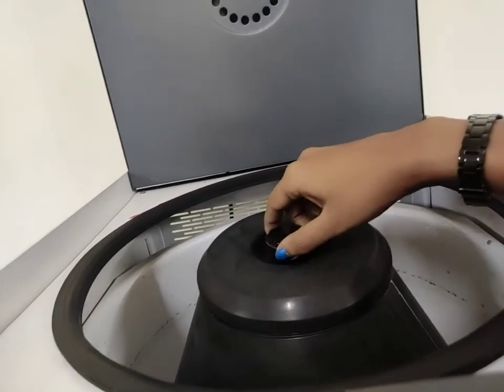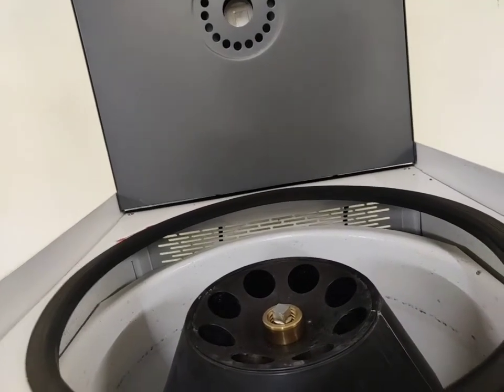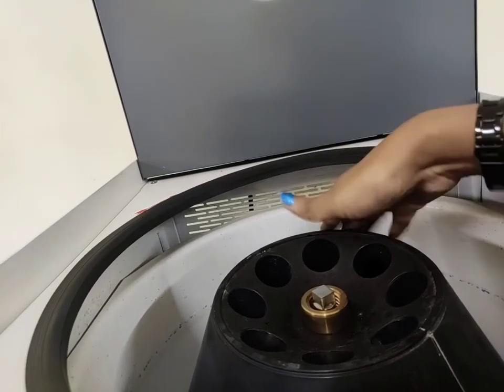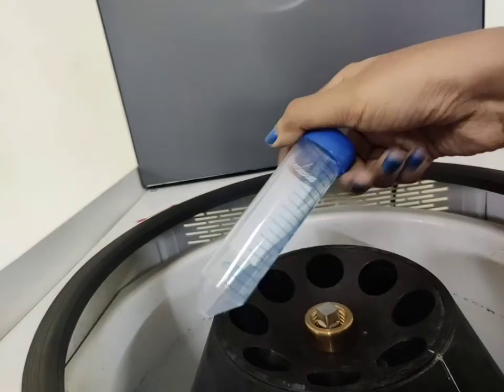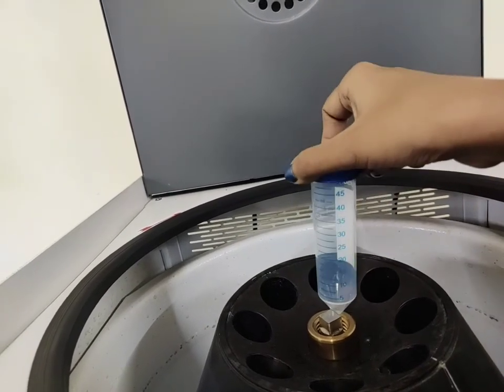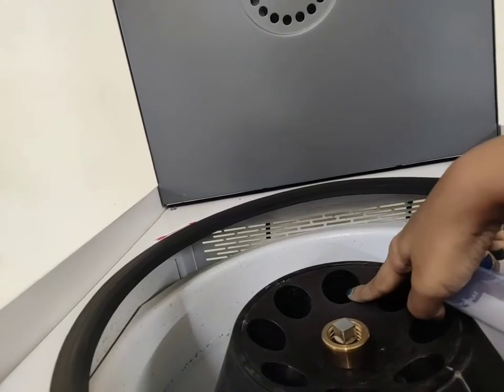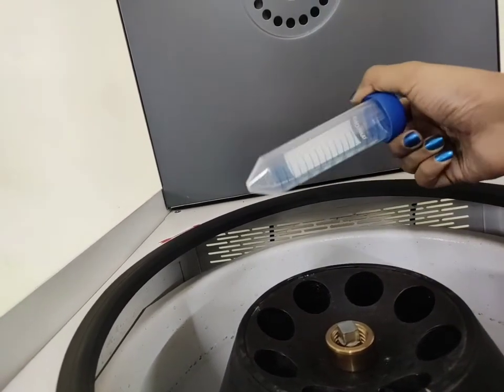For keeping the sample, you have to open the lid of this rotor — this is for safety so that your sample does not fly out during rotation. This is the main rotor, and you can see the holes where you have to keep the centrifuge tubes. The size of these holes differs from instrument to instrument or rotor head. This rotor head accommodates sample tubes of 50 ml. If your sample volume is less — say around 15 ml or 25 ml — you would need to use tubes of that size, but in this rotor you cannot fit 15 ml or 25 ml tubes. So you have to change the rotor head depending on the sample volume. In food analysis, most of the time we get extracts of around 40–50 ml, so this kind of tube is used.